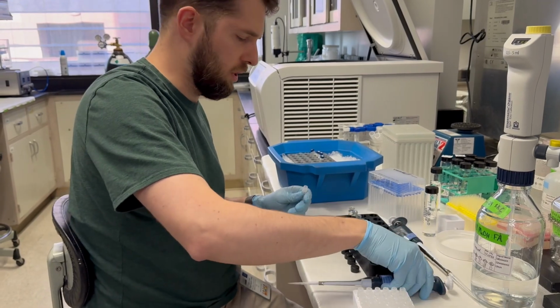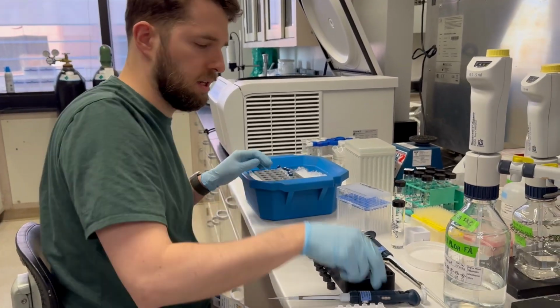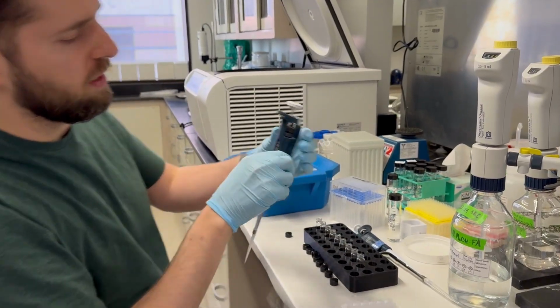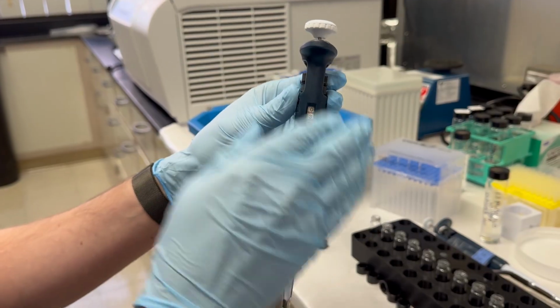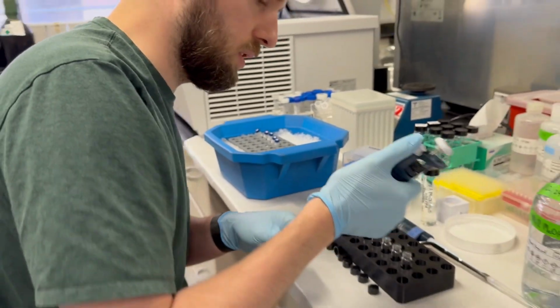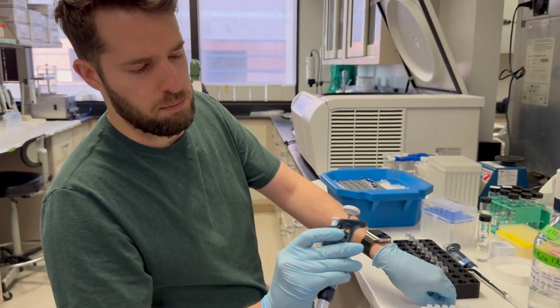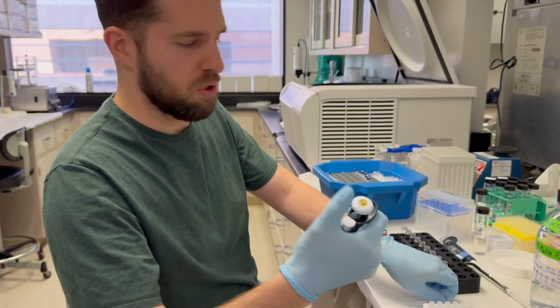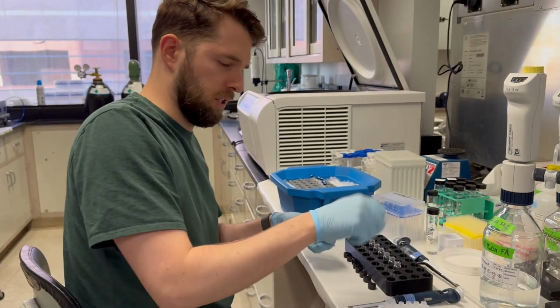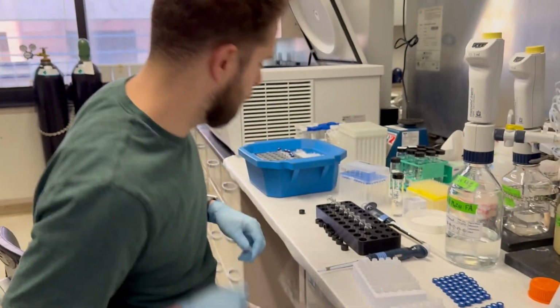Awesome. And one thing I'm doing between vials is I'm also taking a peek at the window here, because sometimes the volume can drift over time. So just make sure that it's staying at the volume that you want it to be at. I think what happens is the little volume adjuster knob is right where your fingers are. So when you push down, sometimes if you twist a little bit, it'll move your volume over time.